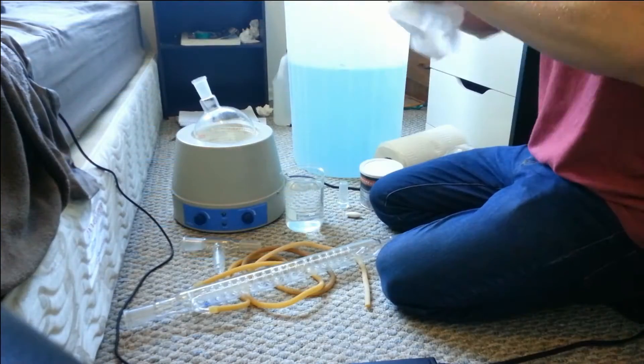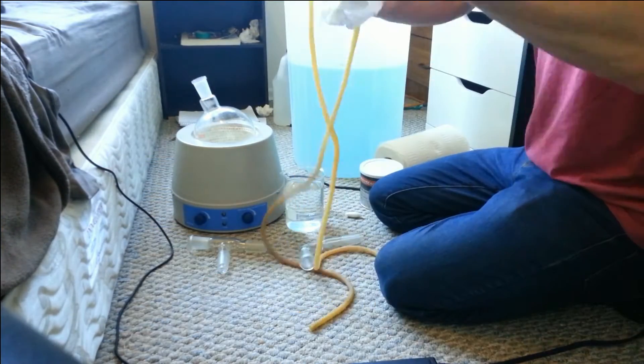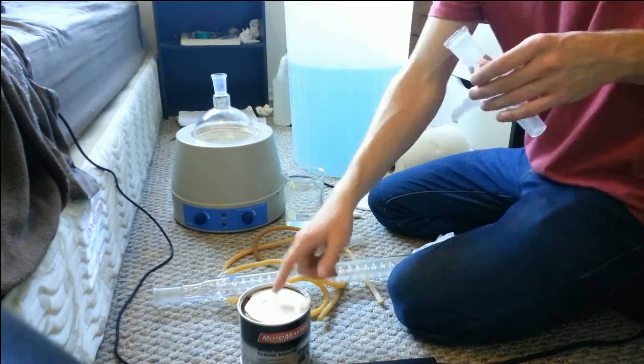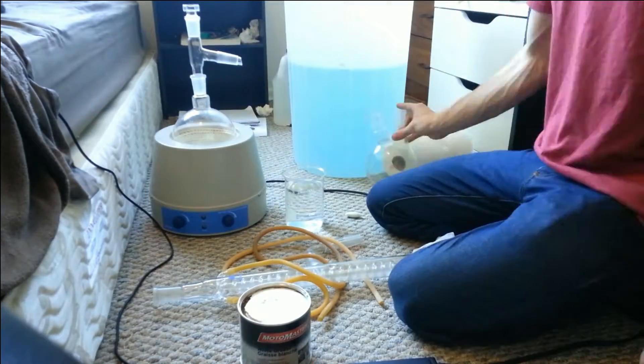To set up simple distillation, you're going to want to set up the apparatus as follows. First, make sure to clean all of your glass joints very thoroughly, and then grease all of them very thoroughly. This is what I'm doing right here.